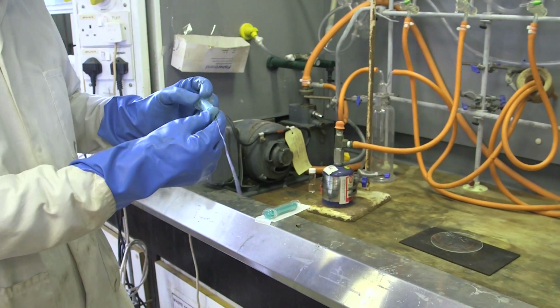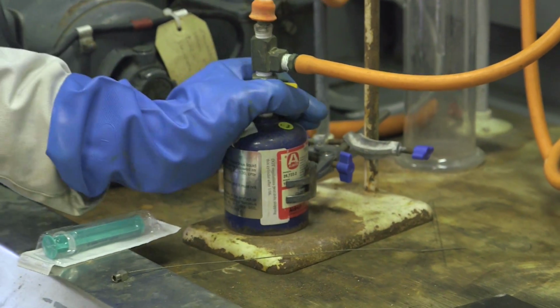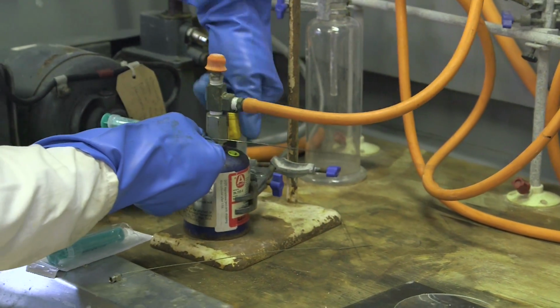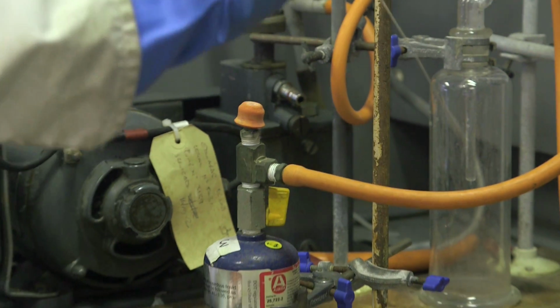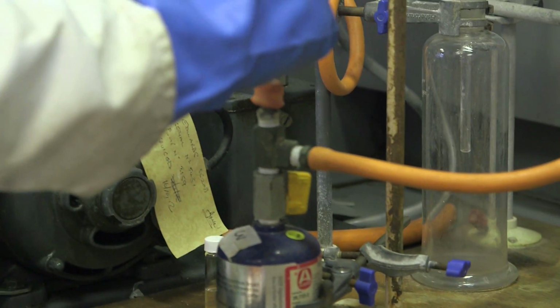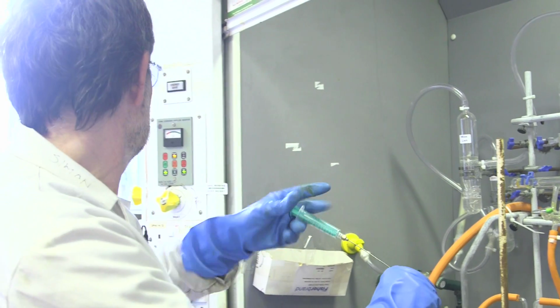So I've got a syringe here, and we've got it contained within this canister. I'm wearing gloves for reasons that will become fairly obvious. So there's going to be a little bit of faffing around here while we get this opened up in a safe way. I'm filling this syringe full of an inert gas. We're using argon today. Argon is completely unreactive.